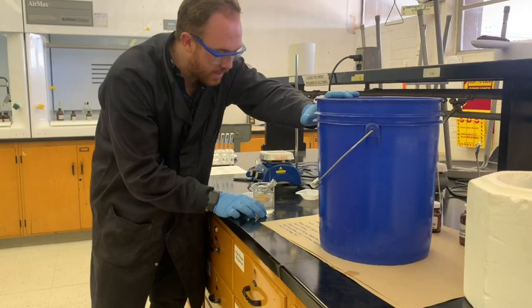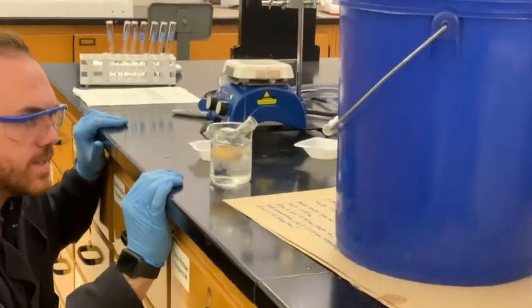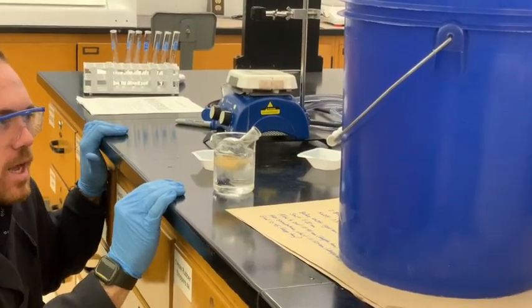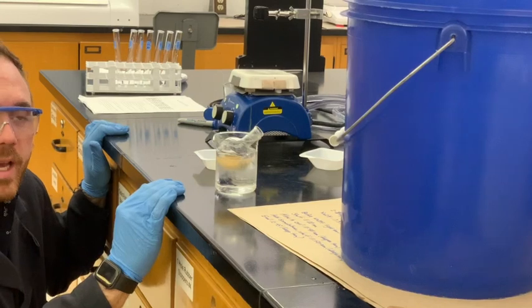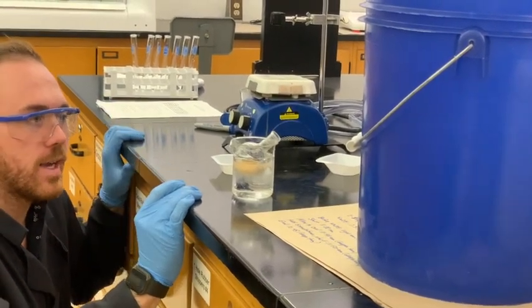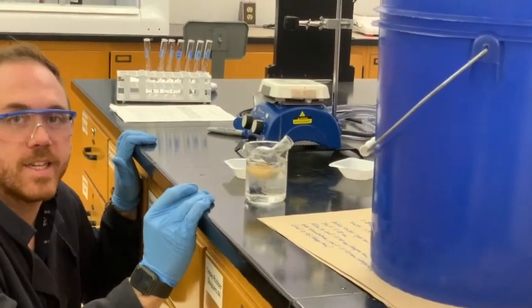As soon as I added it to the ice bath too, it began pretty quickly to precipitate more intensely. That gives us a nice fine precipitate. If we recrystallize this, you'd probably end up with a more shiny, crystalline, jagged and less fine precipitate, but we're probably not going to have time for that today. You can always increase the quality of a product by recrystallizing it. Never a bad idea.